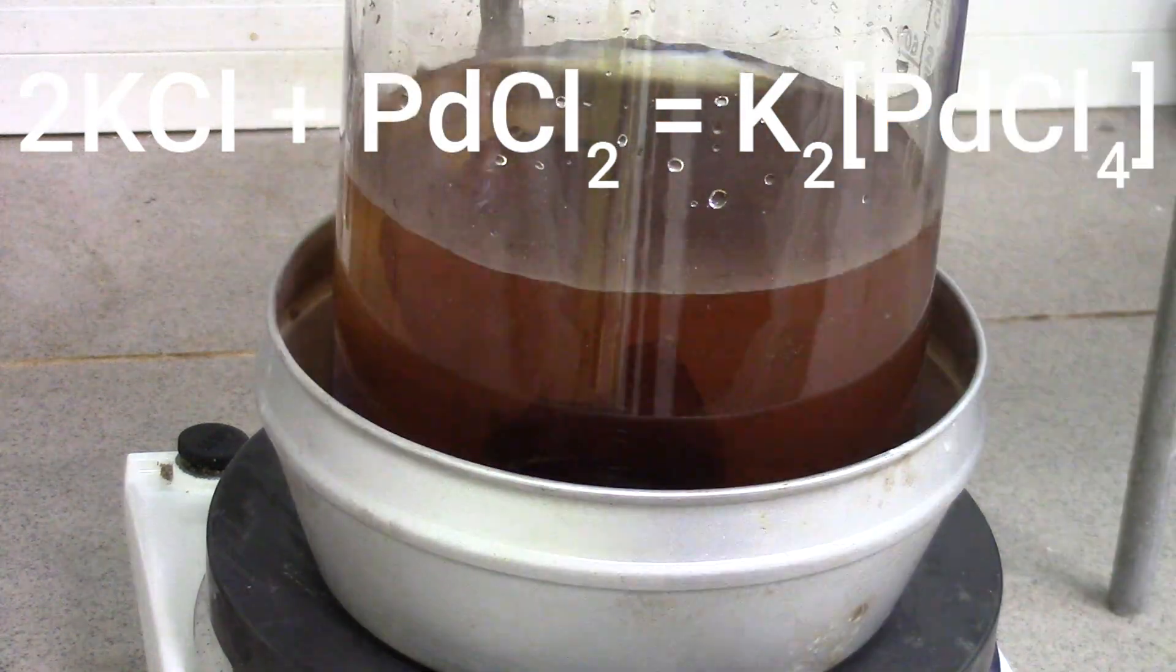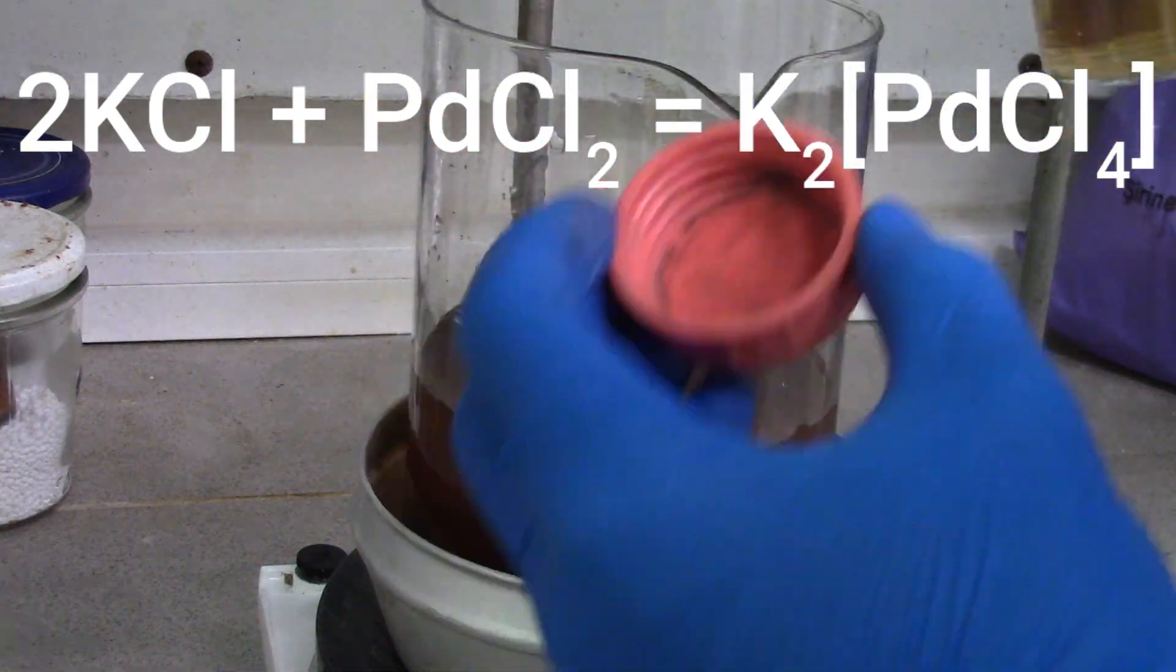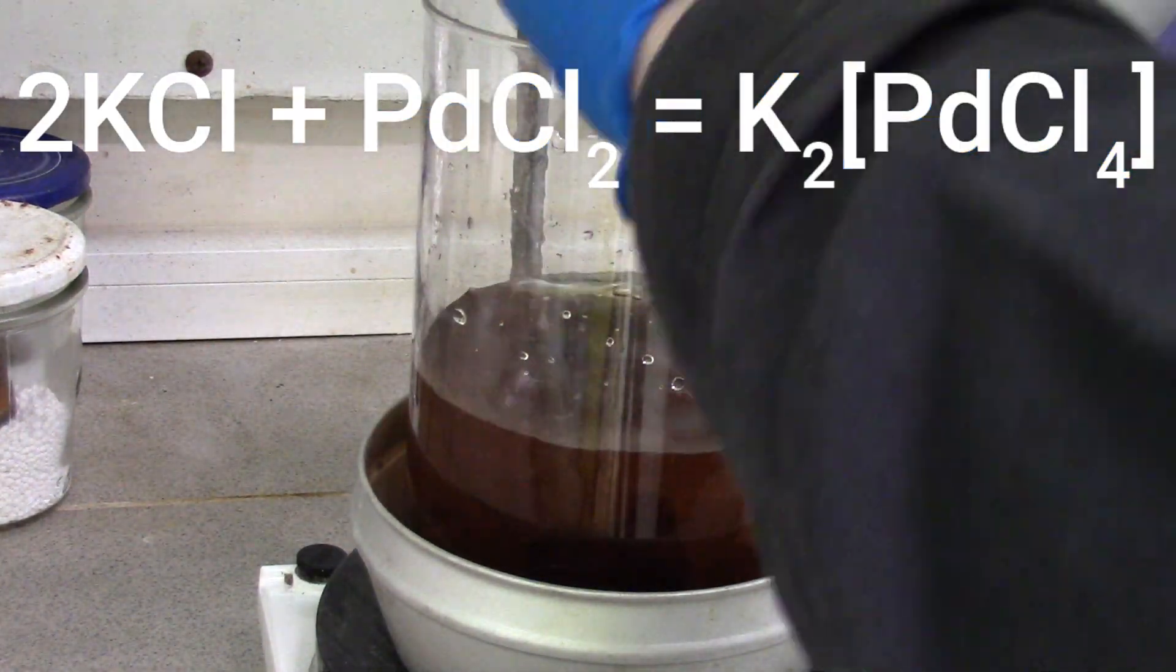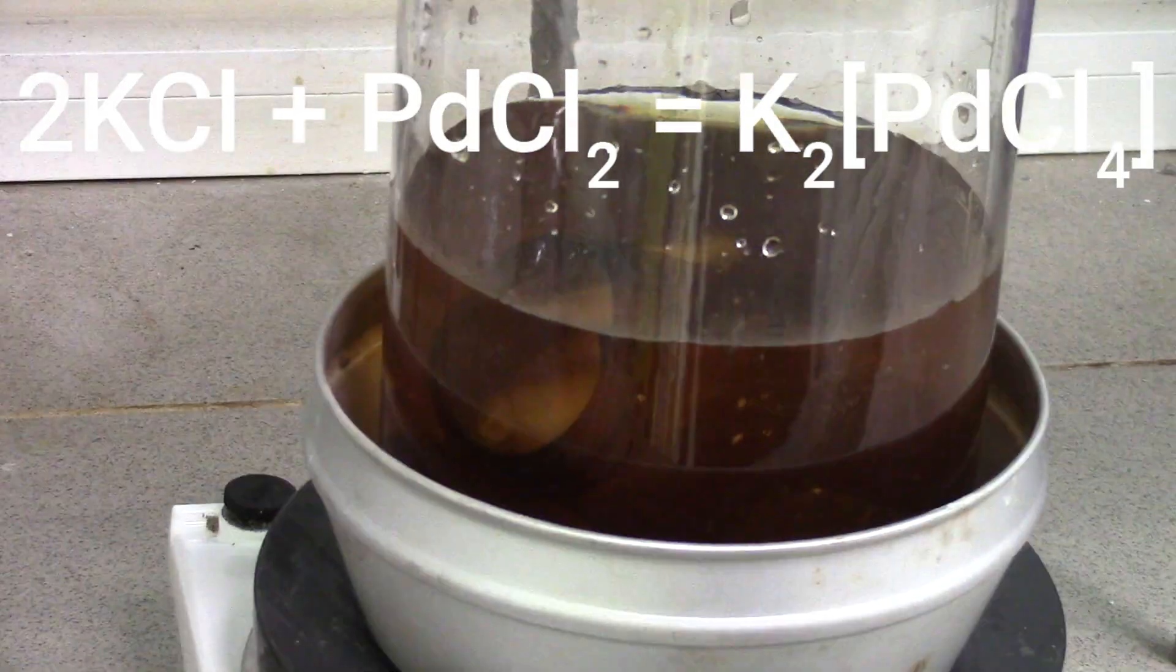Frankly said we could use hydrochloric acid but it's not a good idea because thus you might also dissolve impurities from floor and outside flat of glass pieces.